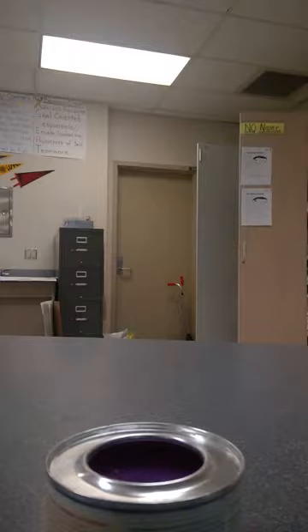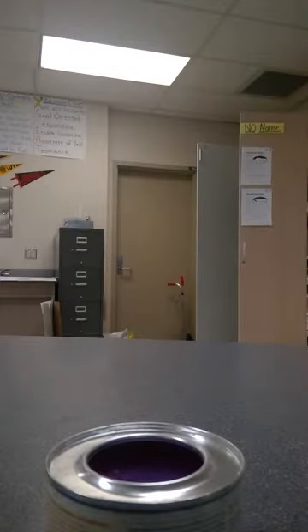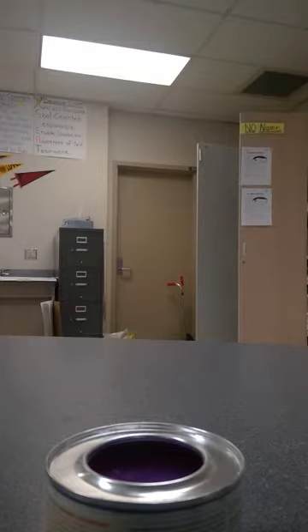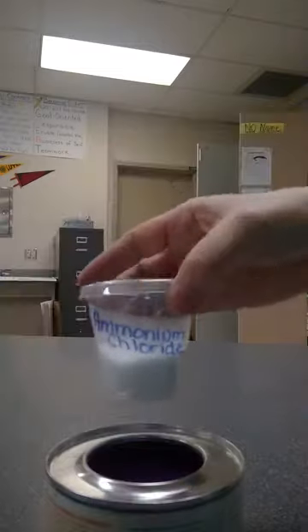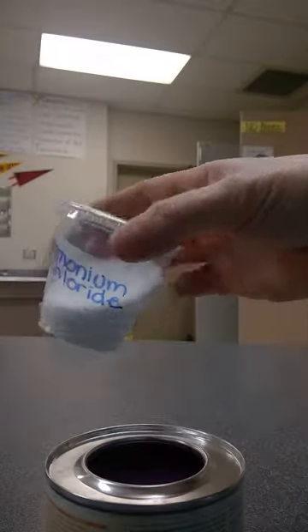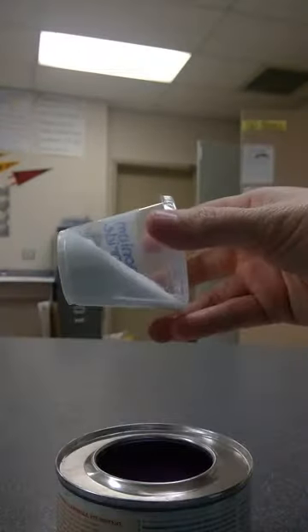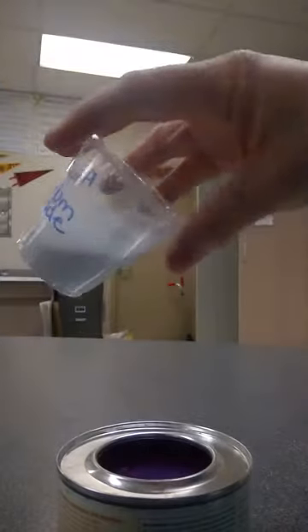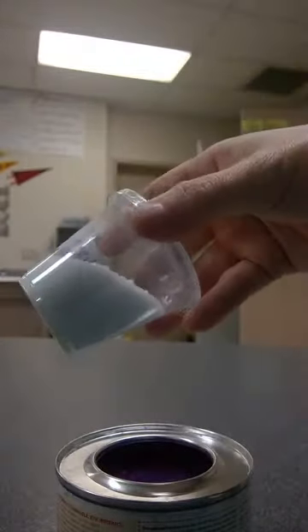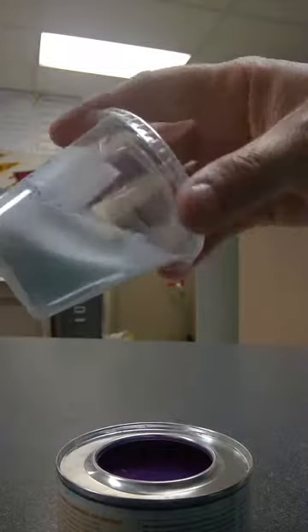Our first substance today is called ammonium chloride. Here is the appearance prior to heating: small granules, some of it clumping together just a little bit. It looks a lot like regular table salt.